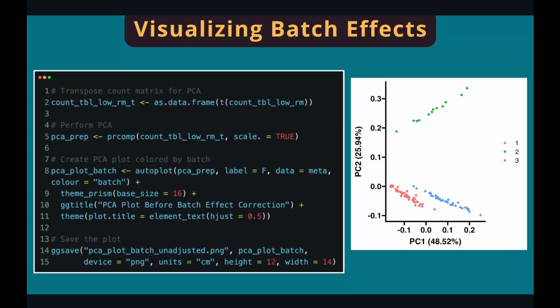Now let's visualize the batch effects using the PCA plot. I've shown you how to make PCA plots using the gene expression matrix before, so I'm not going to repeat it again, but we just transpose the gene expression matrix and turn it into a data frame, feed the data frame to the prcomp function, and use autoplot to plot the PCA, as I showed you before. As you can see, the samples are clustered clearly by the 3 batches, and they are widely separated.